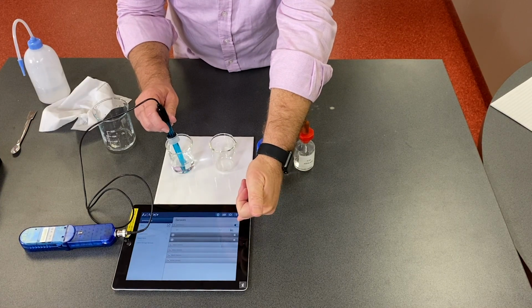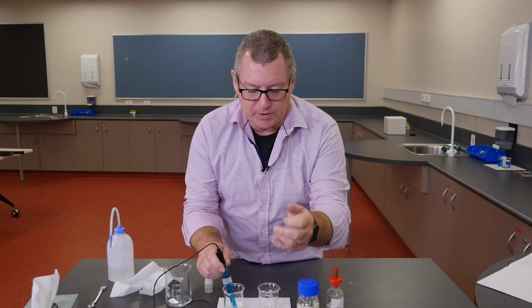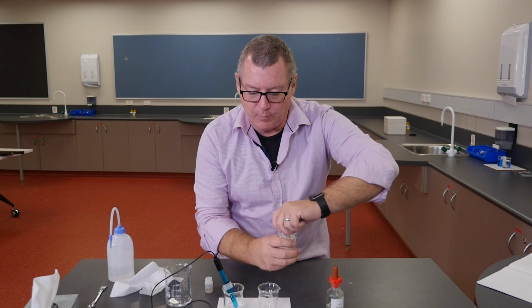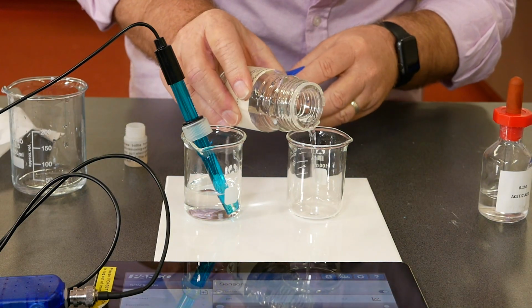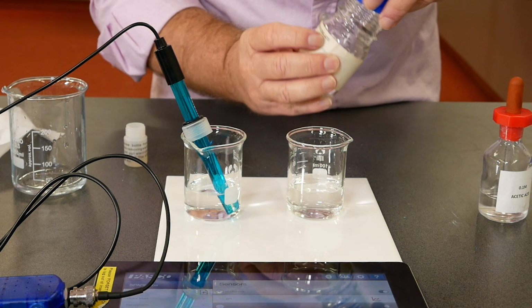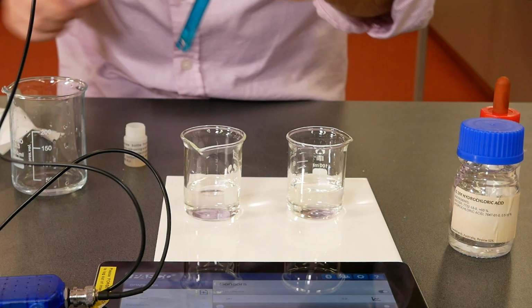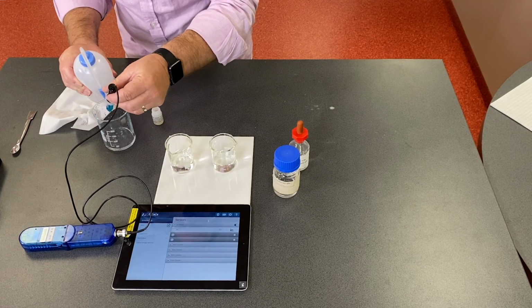So that is a quite acidic pH. Remember that pH will be 7 for neutral. 3.2 is reasonably acidic and behaving acidically. Let's compare that with the hydrochloric acid, which is the stronger acid. Same concentration, different type of acid. So we'll pour a similar sample, but we don't want to contaminate that with our acetic acid. So we'll take the electrode back, give it another good wash with deionized water. So we're just making sure that it's as clean as it can be.